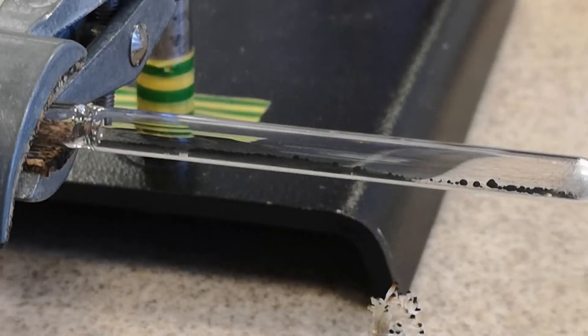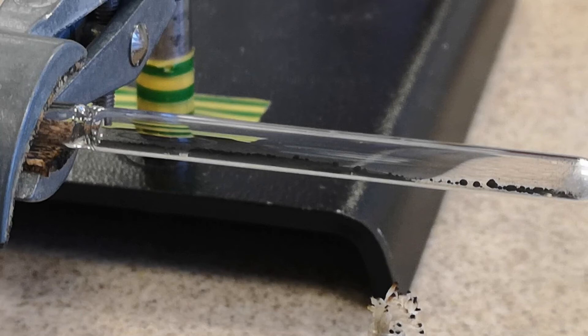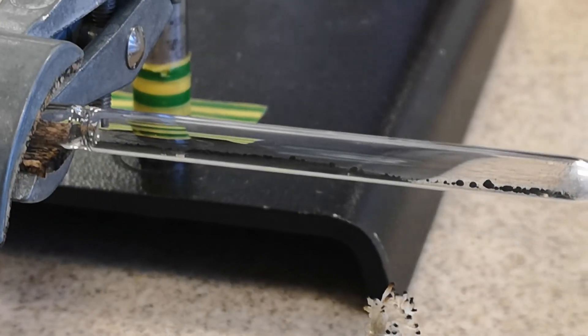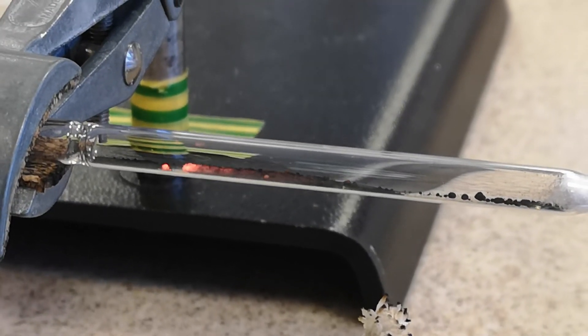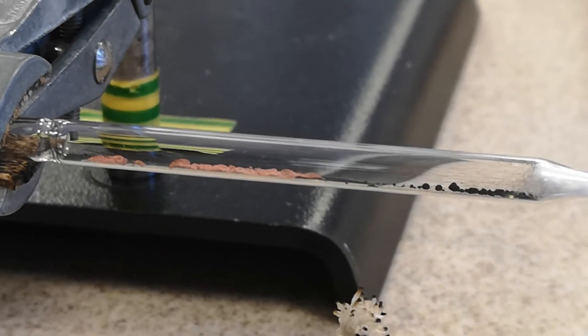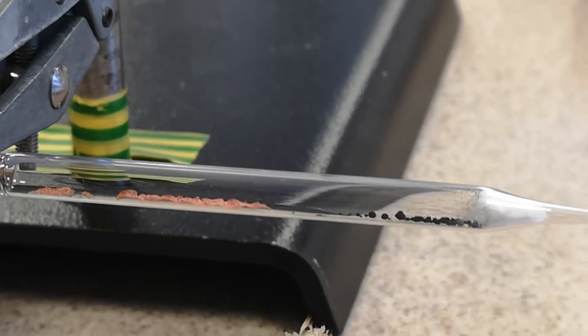A much better way to reduce copper in the laboratory, though not suitable for industrial use, is to use hydrogen. In this example, copper oxide is heated inside a glass Pasteur pipette and then hydrogen is passed over it from a syringe. You can clearly see a glow of the reaction mixture and the appearance of metallic copper in the tube. The only other product is water vapour, and this is emitted as steam from the end of the pipette.